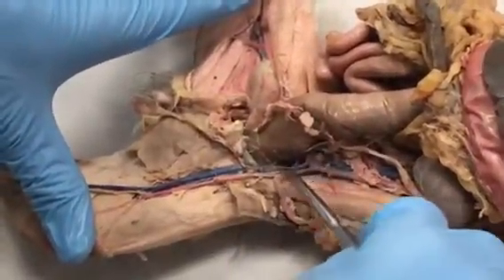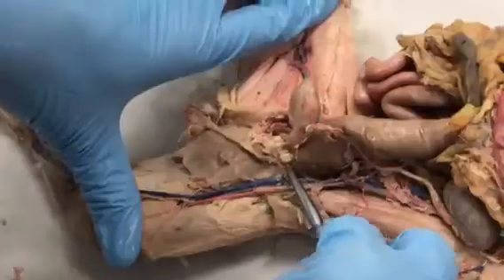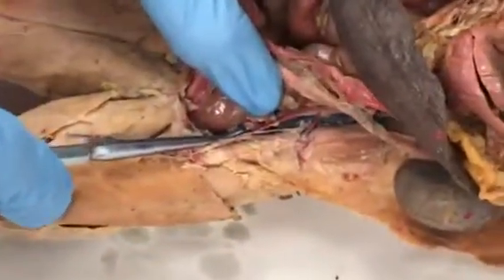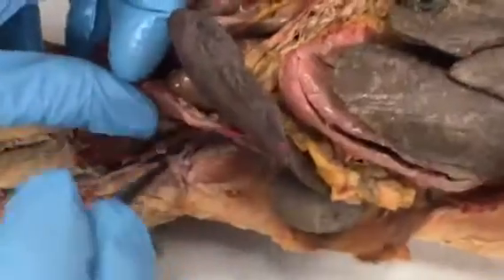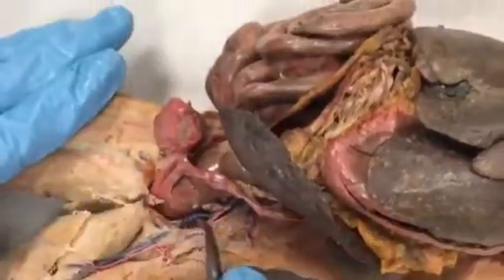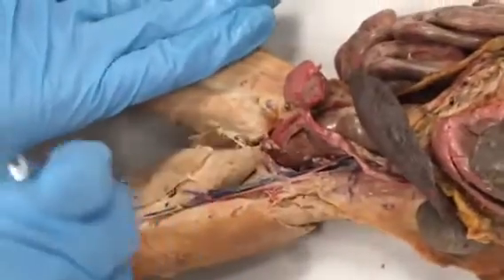And the common iliac veins will run down until there's a branch that branches off and usually goes deep. This is the branch right here. On this other cat it might be a little bit easier to see. In this case you can see it pretty clearly. It's right here. And that is the internal iliac vein. So this is the left internal iliac vein. As soon as the common iliac vein, which is right here, sends a branch down internally to become the internal iliac vein, the common iliac becomes the external iliac vein. And it continues on into the leg as the femoral vein.